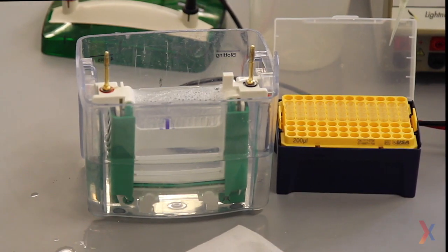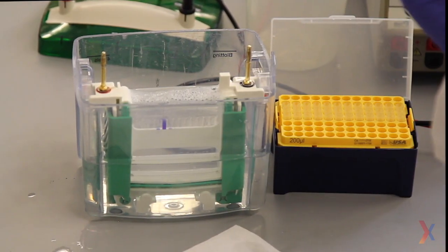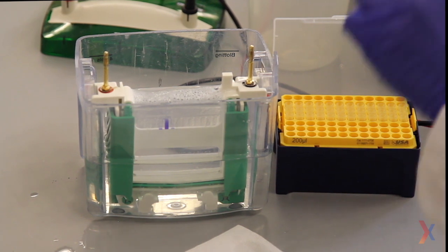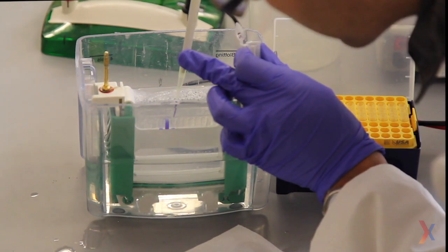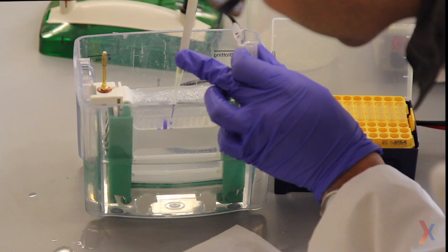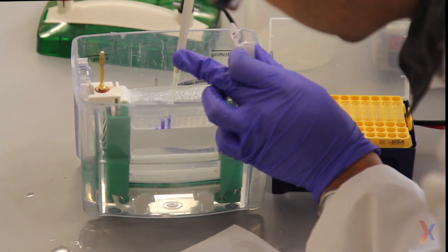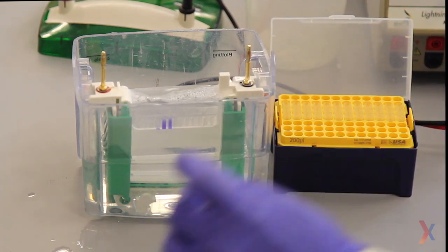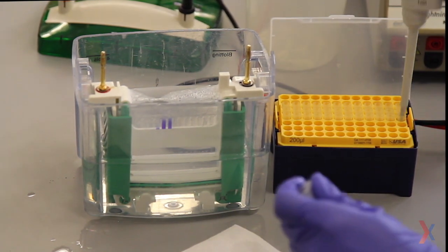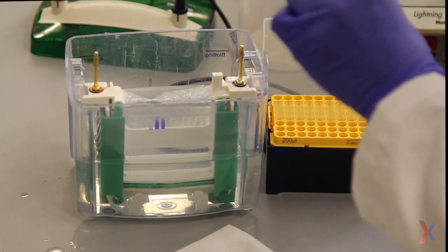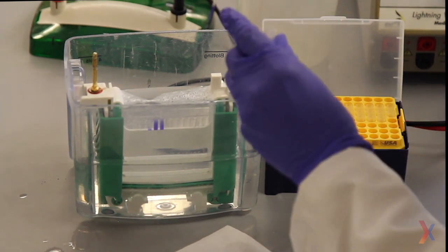And after that I will add our four samples in order. To load these, I place the tip just a little bit into the gap between the two glass plates and then very carefully dispense the sample into the wells.